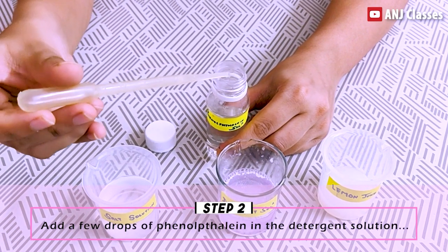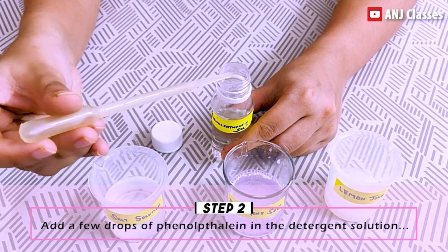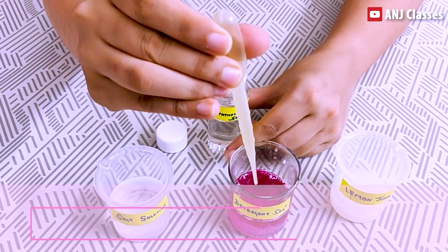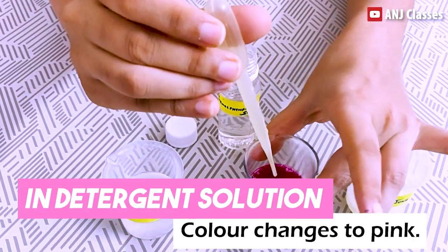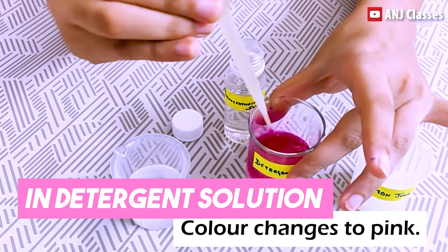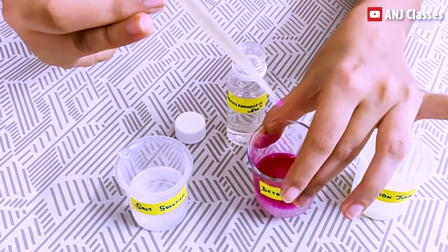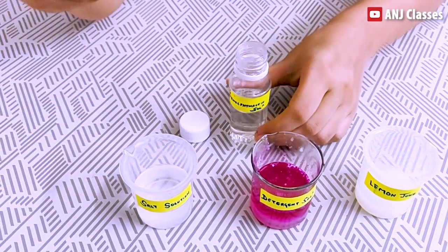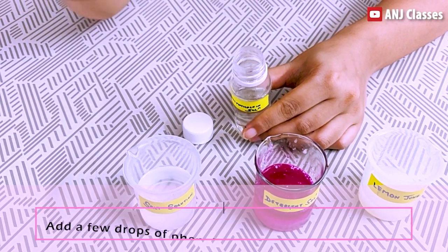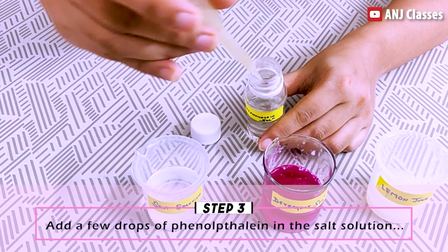Now I will pour few drops of phenolphthalein solution into my basic solution, that is detergent. You can see my detergent solution — my basic solution — turns pink in color.